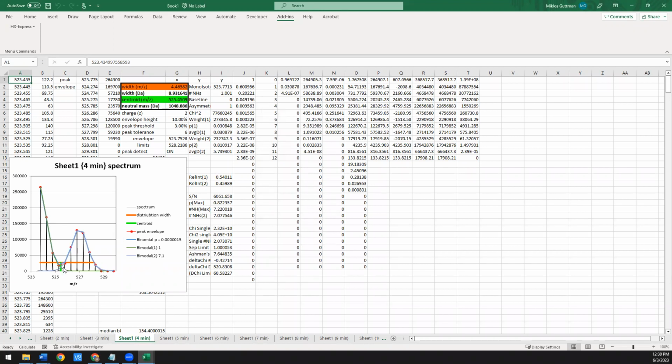So here in green is the fit for binomial 1. And then this is the blue fit, which was the second population. The dark blue here would be the sum, which you can't really see well, but what you can tell is it looks great. The fit was able to fit everything and explain the data really well. The second fit here used a number of amides at 7.1, which we know is about what we expect if you have a uniform population. So this is one thing here and another thing here.